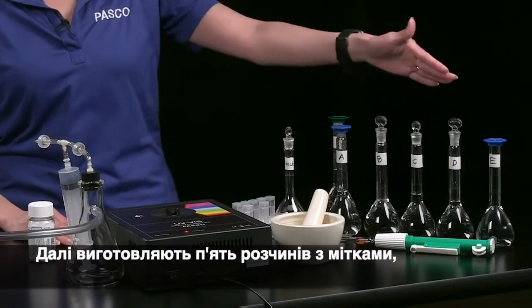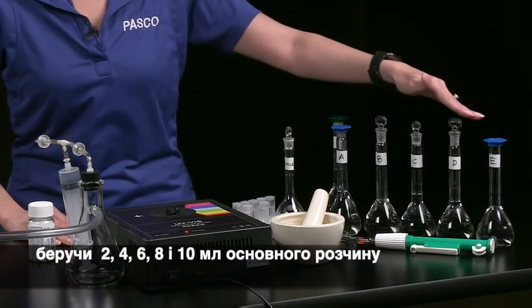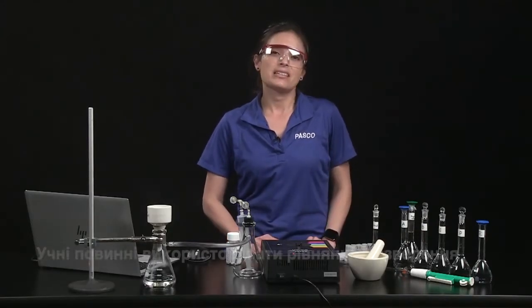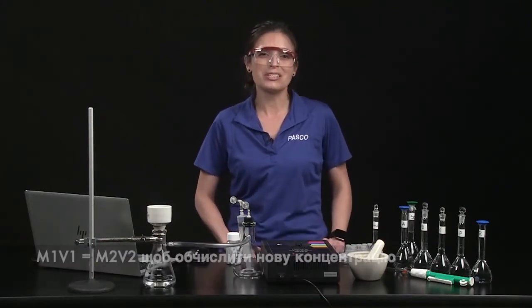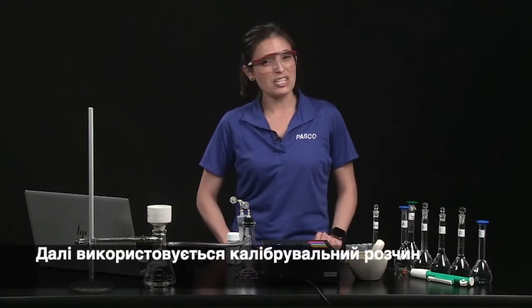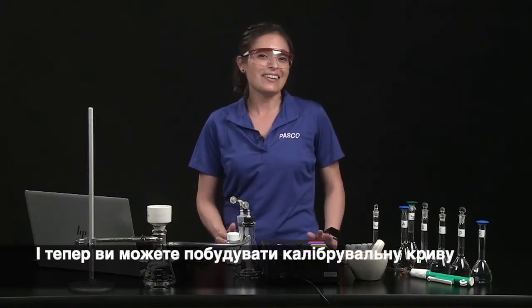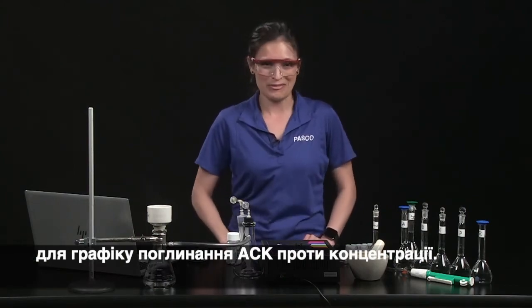Next, 5 solutions labeled A through E are made by taking 2, 4, 6, 8, and 10 milliliters of stock solution and diluting each to 100 milliliters with distilled water in a volumetric flask. Students must use the dilution equation M1V1 equals M2V2 to calculate the new concentration of each solution based on the volume of stock solution used. Next, a calibration solution is made by mixing 0.8 milliliters of 95% ethanol with 9.2 milliliters of distilled water. And now you can construct the calibration curve for an ASA absorbance versus concentration graph.